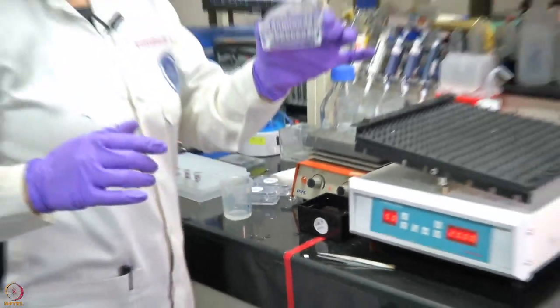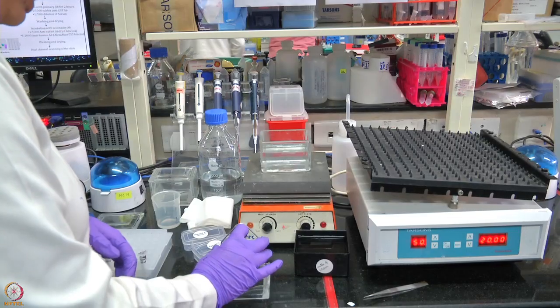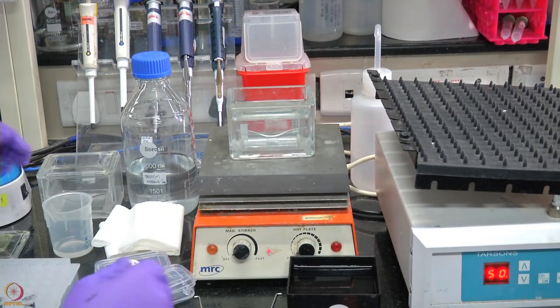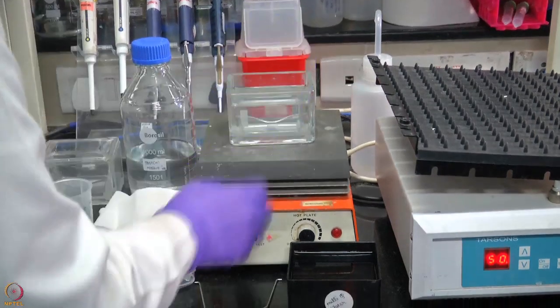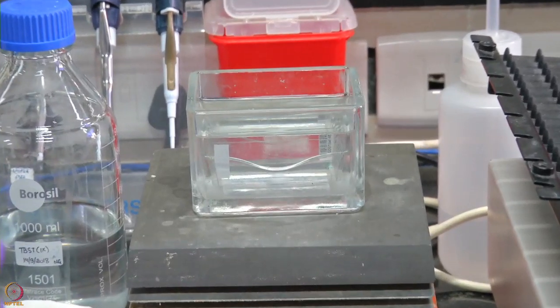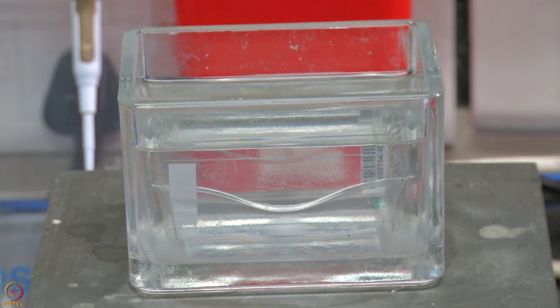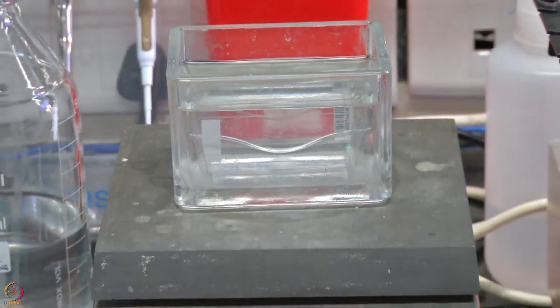This is how the cassette looks; we keep the protein area facing each other. We take the cassette and place it into the washing buffer, which is 1x TBST at pH 7.4 so that protein structure remains intact. A magnetic bead is used for circulation of the buffer to ensure the slides are washed properly, removing extra blocking buffer from the protein spots. This washing step is performed three times for 10 minutes each.